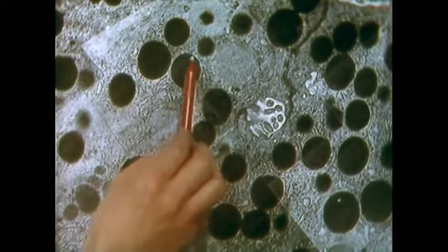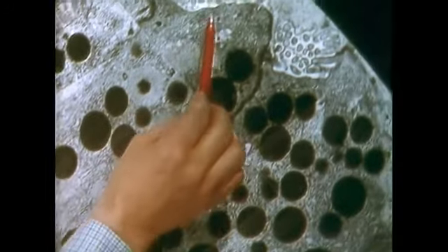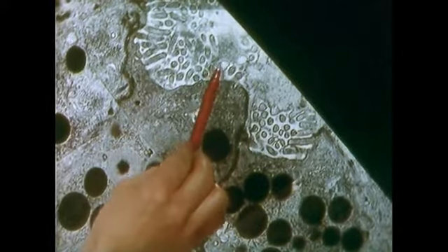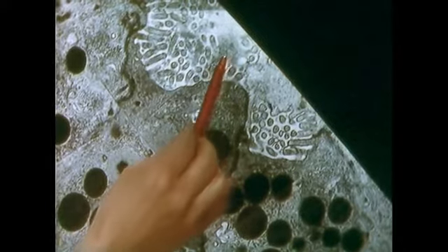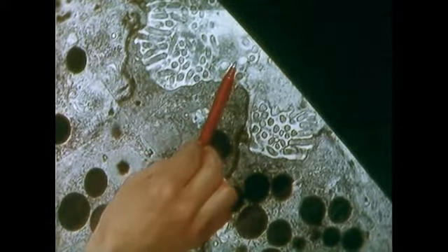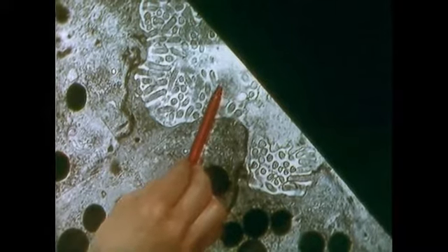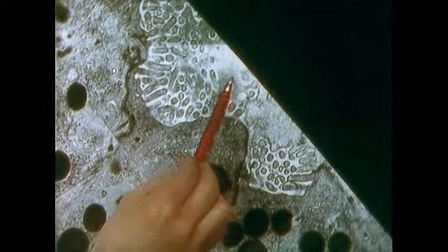It's difficult to see at this magnification, and as we move up towards the apical membrane of the cell, we can see that there is a lot of floccular material in what's the lumen at the top of the cell. These large dark granules in the cell are probably secreted into the lumen. So the enzymes would be secreted from the cell into the lumen and passed down to the pancreatic duct.